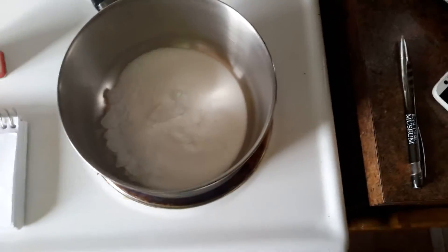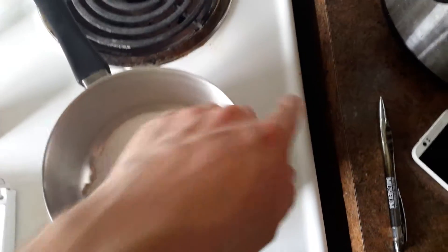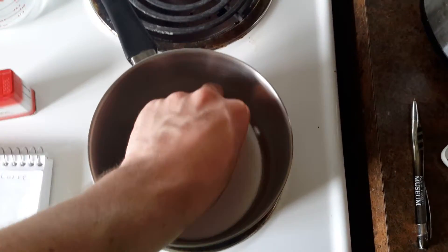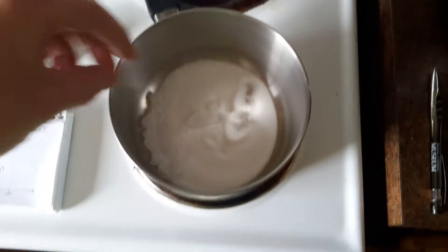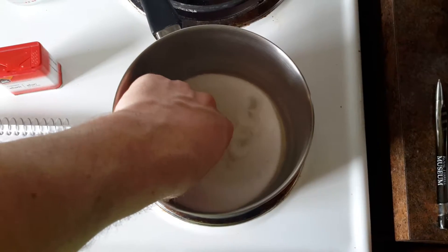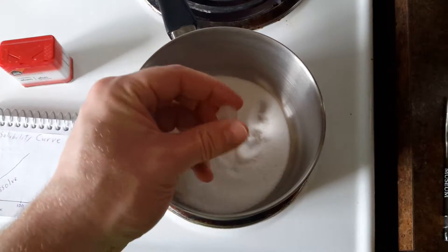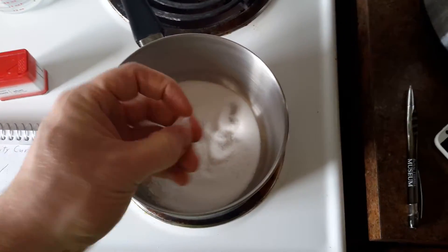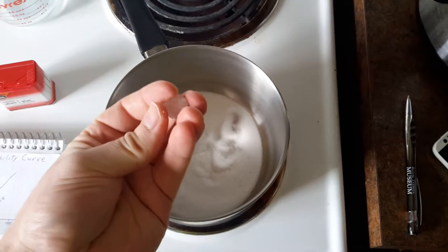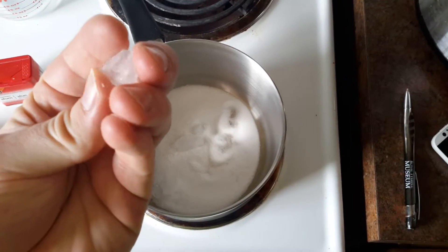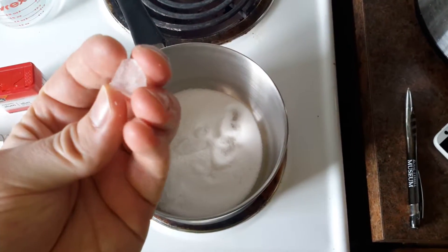So I've got about seven grams of alum here - the powdered alum fresh out of the container, and I also have some alum that I'm re-dissolving. I originally got it from a container in powder form, then I created a supersaturated solution, and it precipitated out from the cooling of the solution.